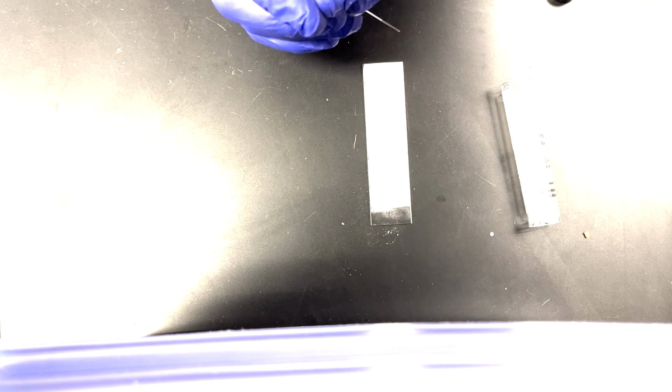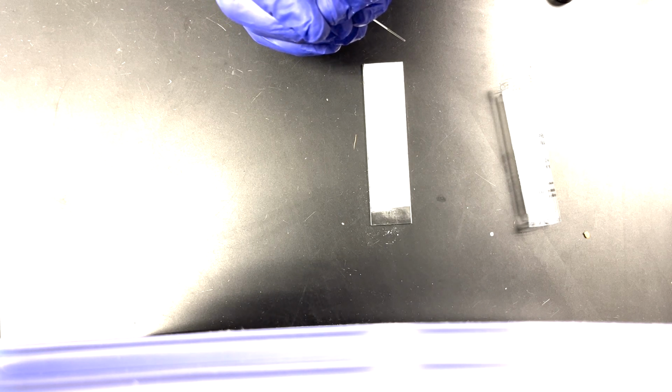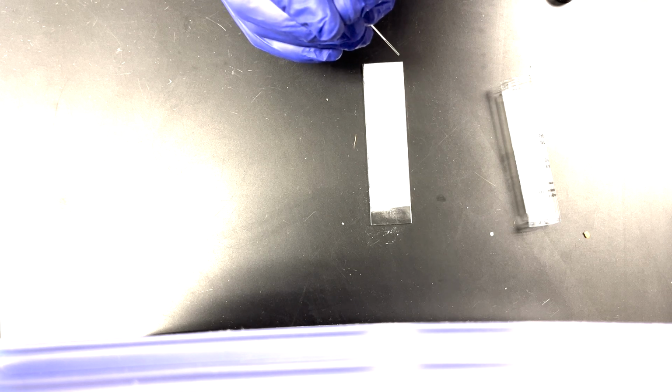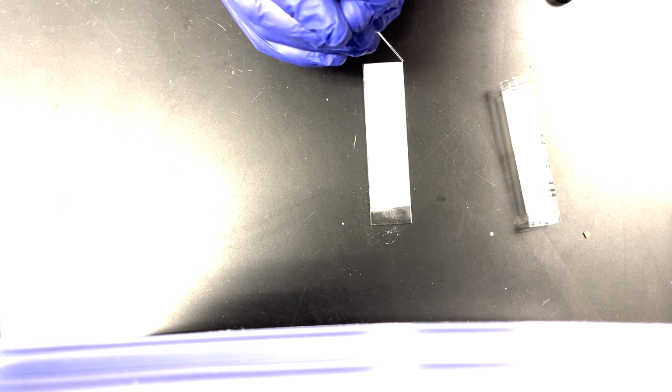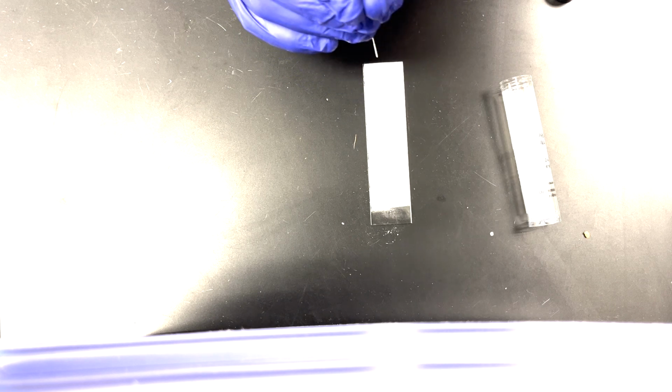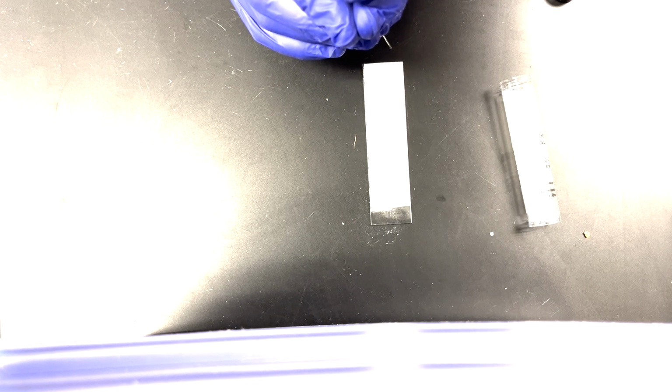and then you wait for that spot to dry. That part is boring. You wait for the spot to dry. If you make your sample in acetone, that'll help things dry up a little bit faster. And then after that spot has dried, you're going to spot it again and again. If you just spot it once, depending on the concentration, you're probably not going to see results.